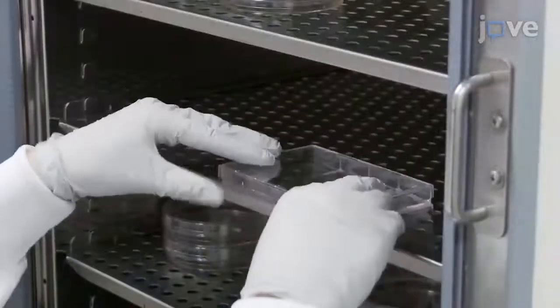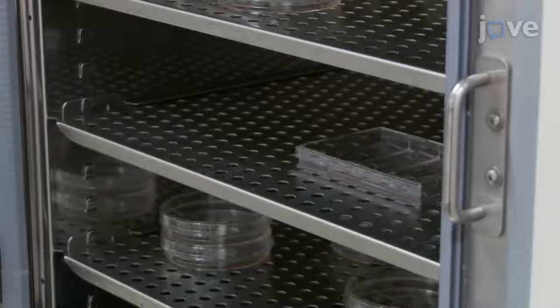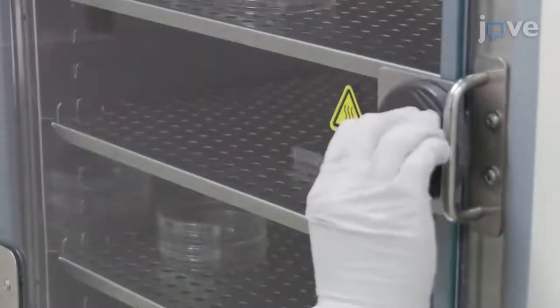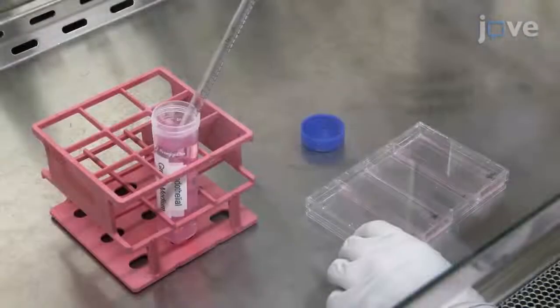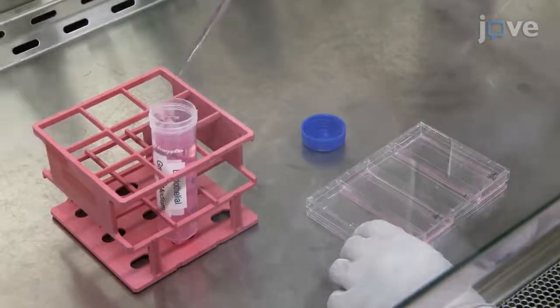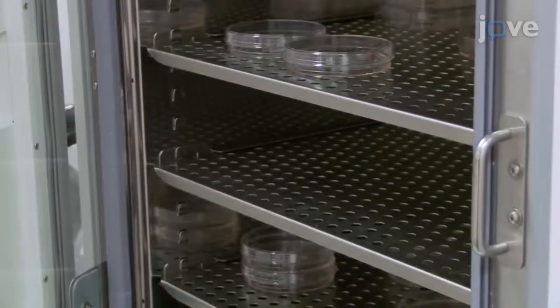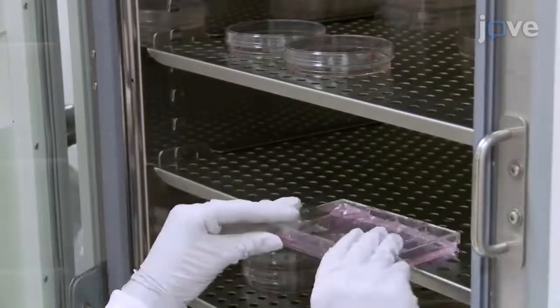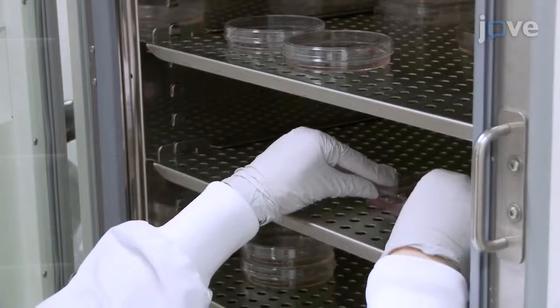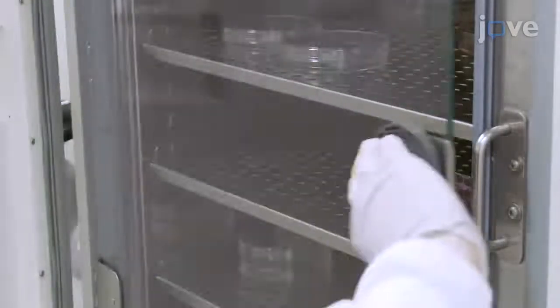Allow the cells to adhere to the slide for 15 minutes at 37 degrees Celsius. Then cover each slide with 3 mL of medium, and place the plate in a cell culture incubator at 37 degrees Celsius and 5% CO2 for 24 hours.